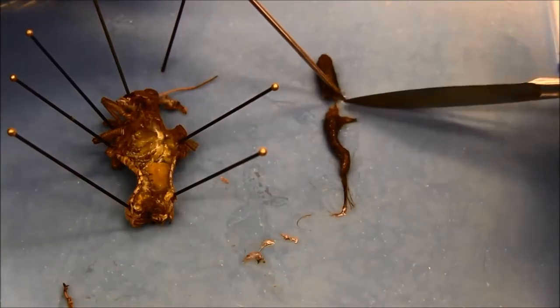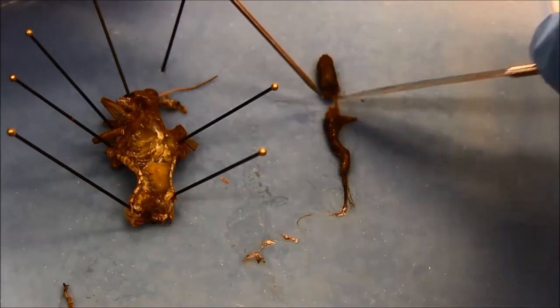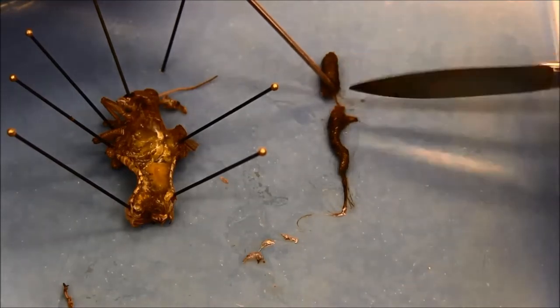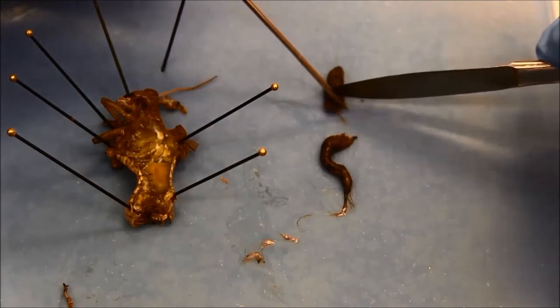Once I find the border between the foregut and midgut and hindgut parts, I use a scalpel to separate them.